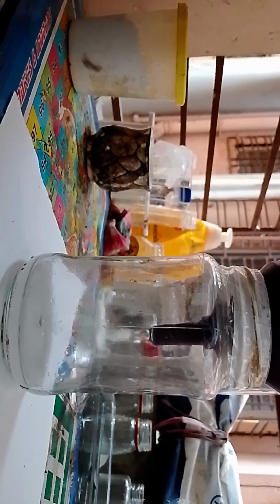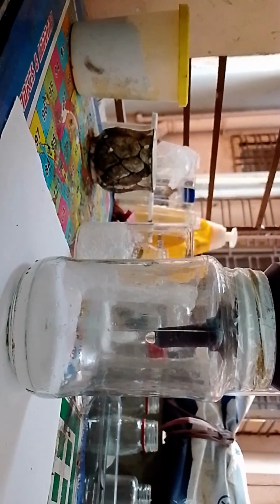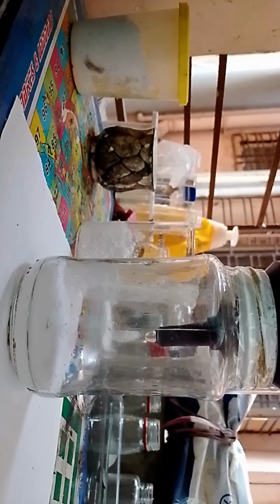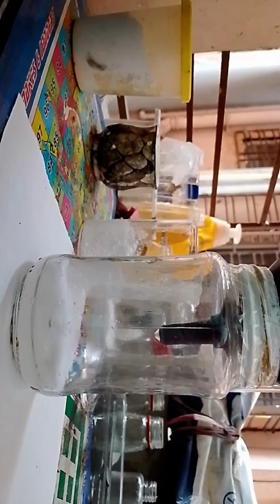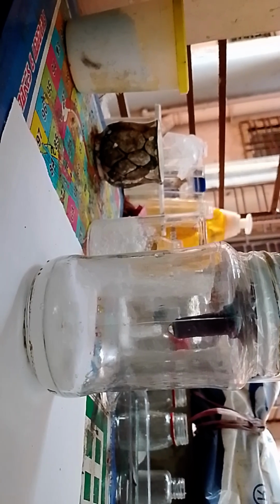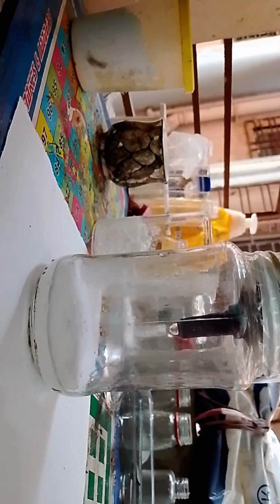The filtration is going on pretty fast, and the solution is a little milky, but I think it is fine. Okay, we need it to filter away, and then we will do a quick refiltration. Okay, I will have to wash my filter once. Yeah, but that will be fine.